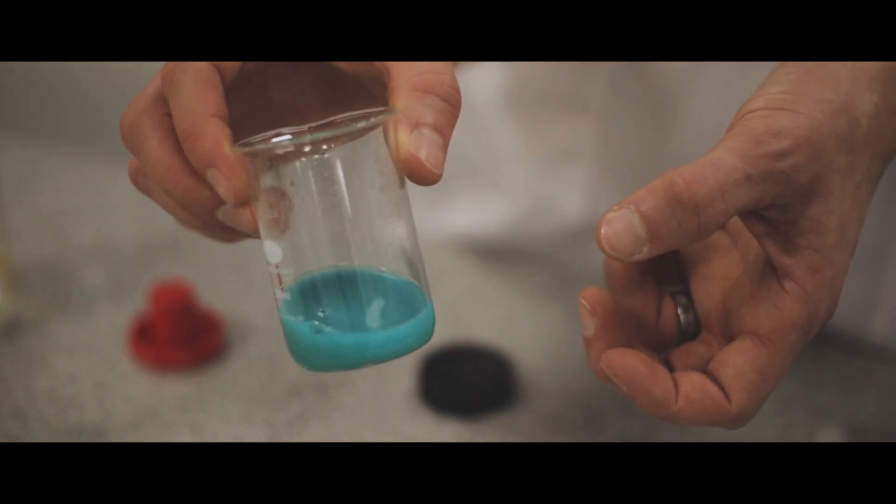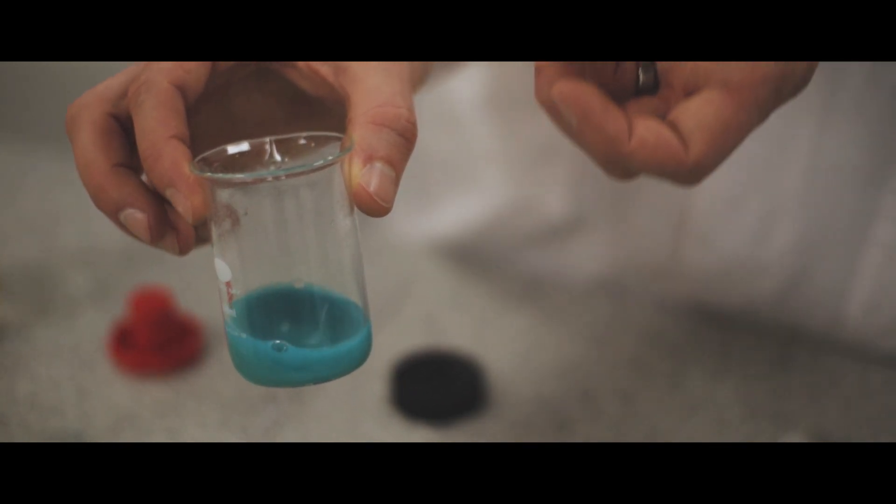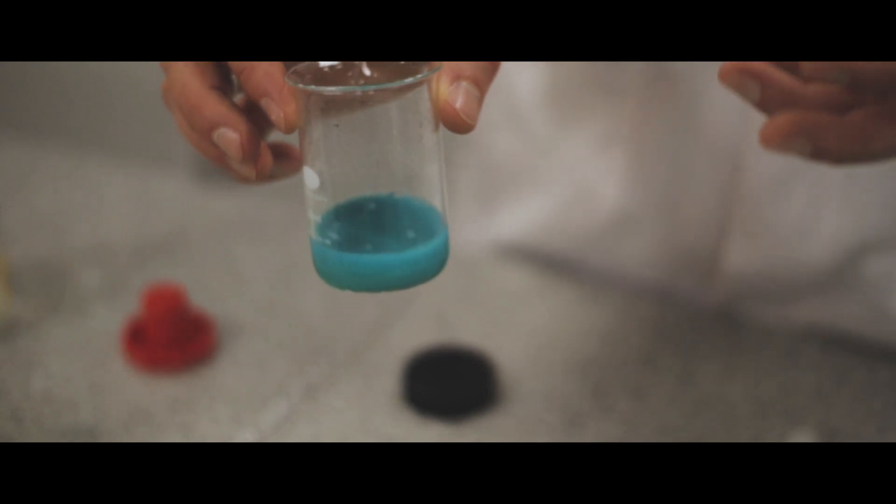At the moment, this solution contains some powdered copper carbonate that I want to get rid of. So we're going to use a separation technique of filtering. Filtering removes a solid from solution.